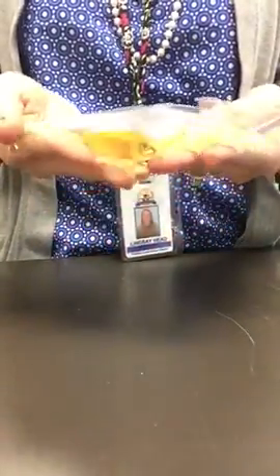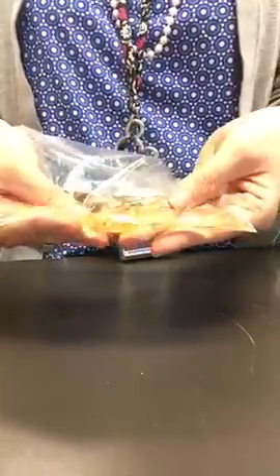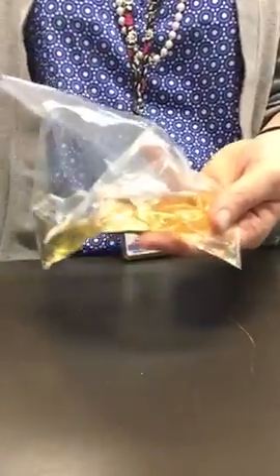So I would say this is no chemical change, no reaction occurred because there was no bubbling, even though a new color was made. It's just a diluted version of sample 3. So physical change, no reaction.